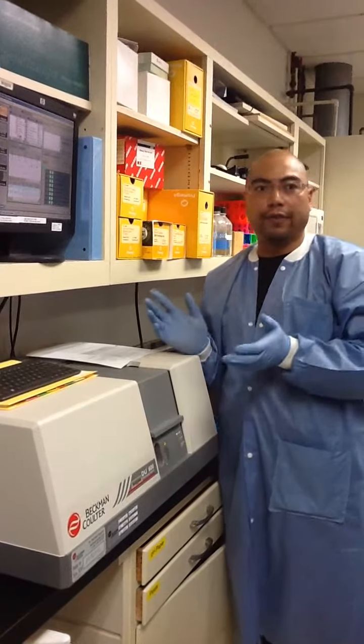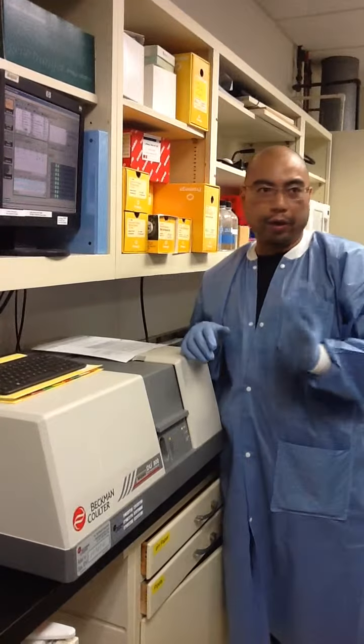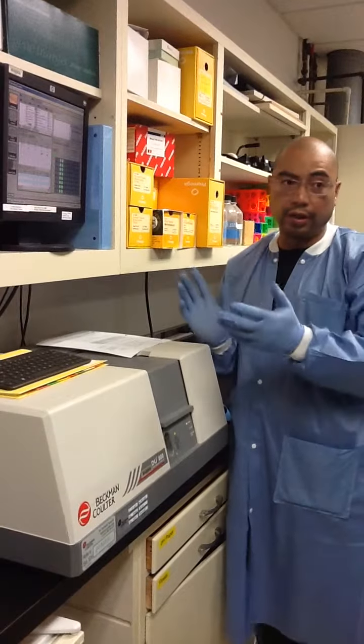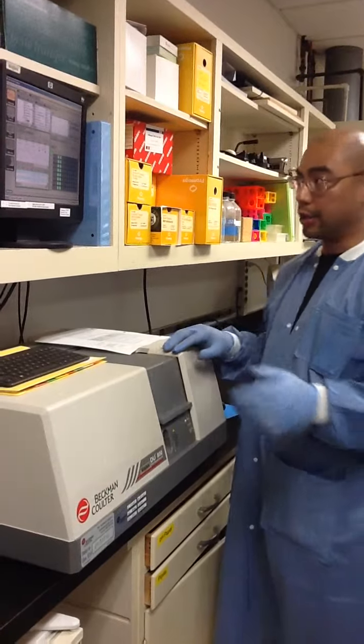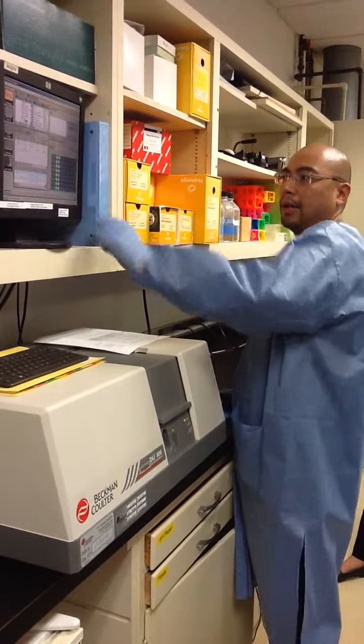But I've set this up in such a way, and running through the actual setup is not necessarily beneficial for you guys, because there are so many different PCR programs and machines that the learning curve for the software is absolutely insane, and it doesn't pay off. I can show you how to use this stuff, but it's probably not going to be the same as what you guys are using.